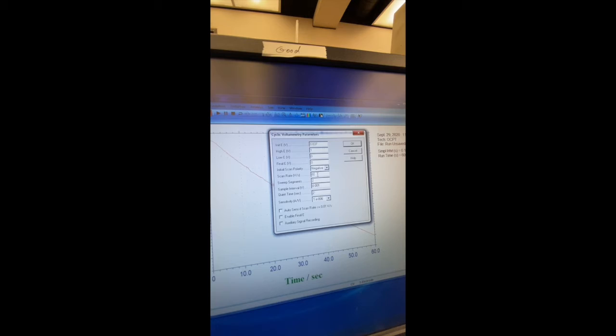So again, up top here, we're going to put 0.037 as our initial E. The high for this part is going to be 1. The low E is 0. We're going to have a scan rate also of 0.05 as we had before. This time the sweep segments, we're going to have 25 for the electropolymerization, and the sensitivity we're going to keep at 10 to the negative 5. So we're all set here.